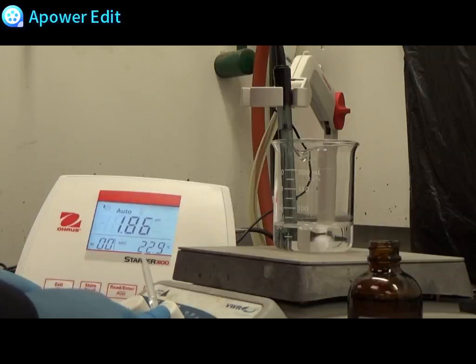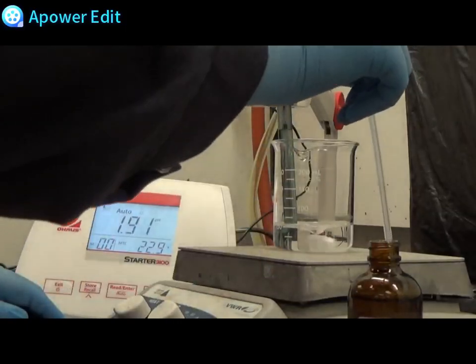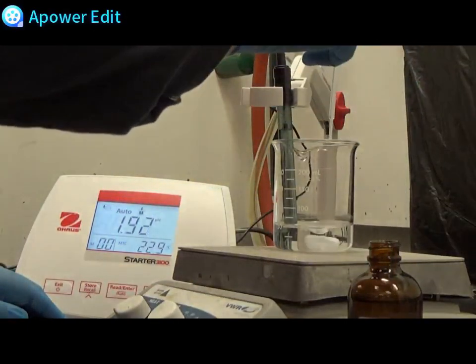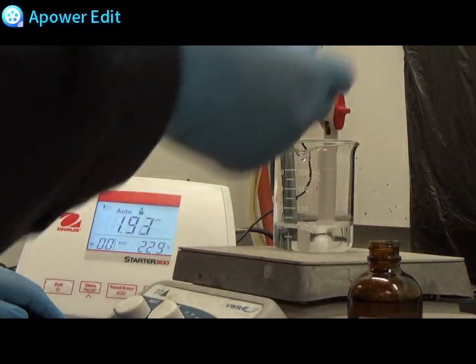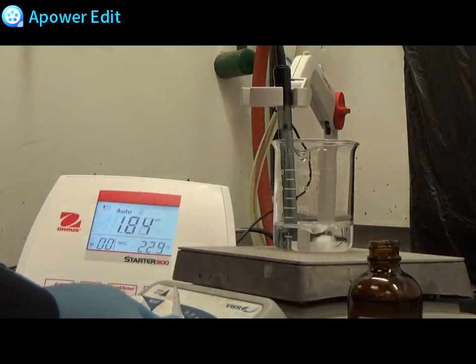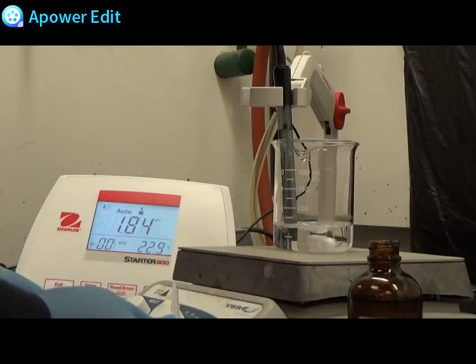Like I mentioned before, we are dropping the pH so that when we start plotting our points, we can start from a very low pH and capture all of the changes in pH as we add more base. Our goal in this lab is to start from a very low pH and end the titration when the pH has reached between 10 and 10.5. This way we can see what's going on at every point and determine when the amino and the carboxylic acid group are deprotonated.